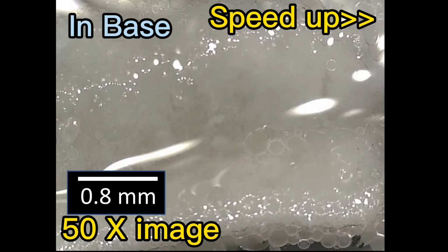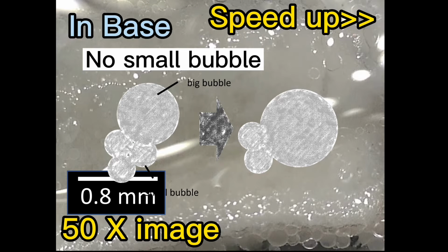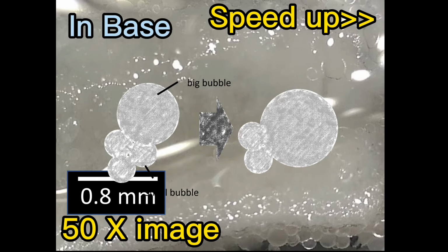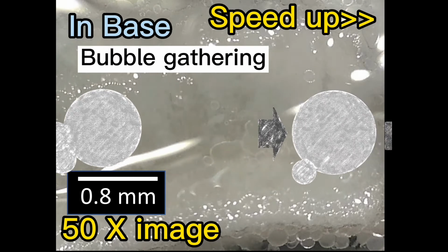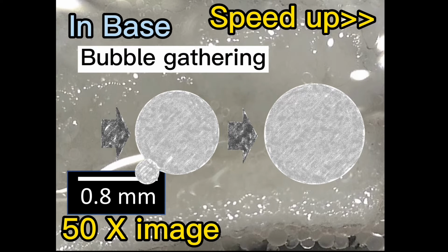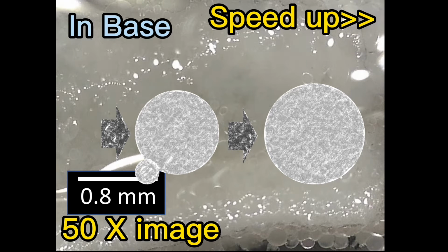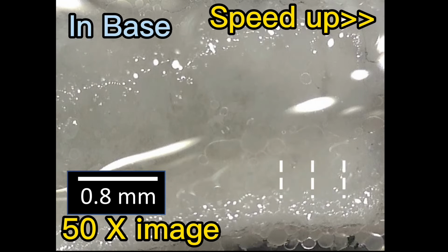As time went on, new bubbles were also formed, and the small bubbles were no longer clearly seen because they were combined with the larger bubbles as soon as they appeared. It meant that the larger bubbles will gradually increase their size. Moreover, you can see the bubbles in the right corner have basically become a whole piece.